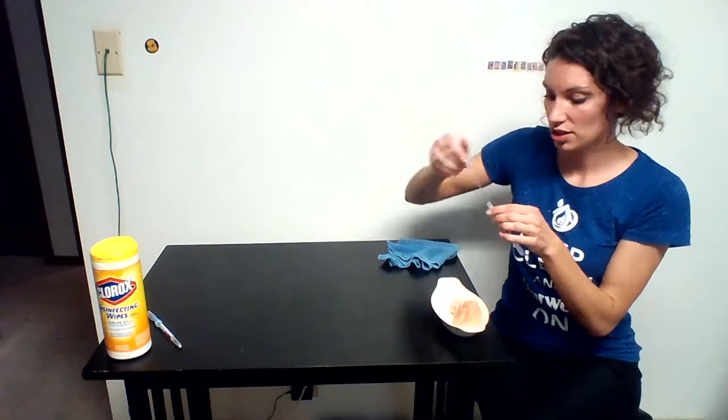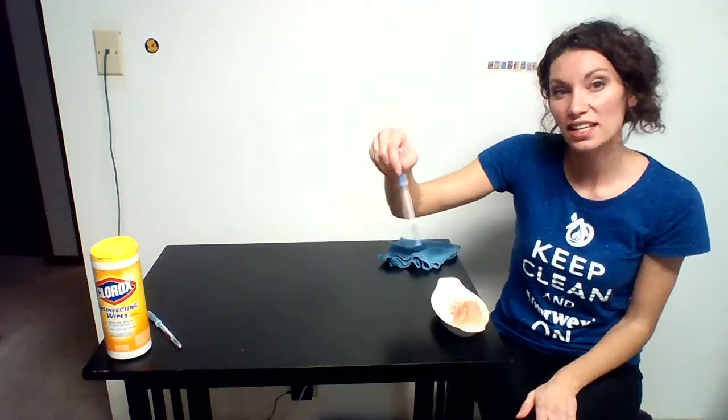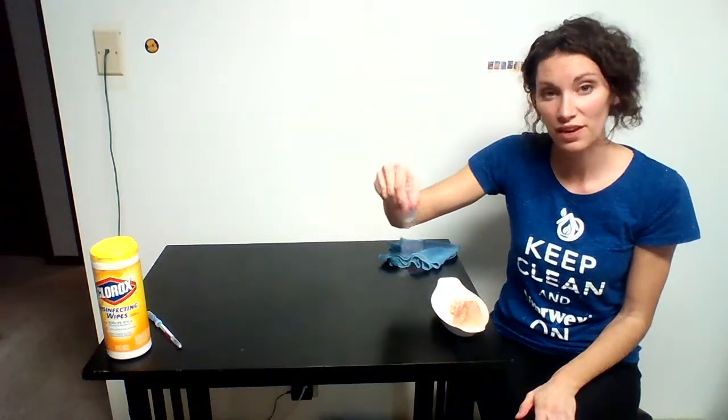So I spread it around. Now I'm going to release the liquid on the swab, which will then have a reaction if there is any residual protein found on the surface.